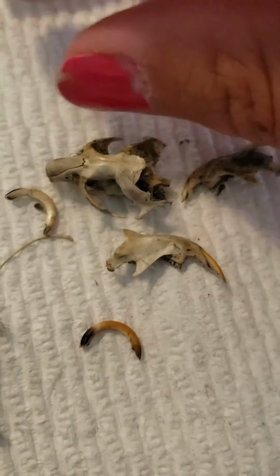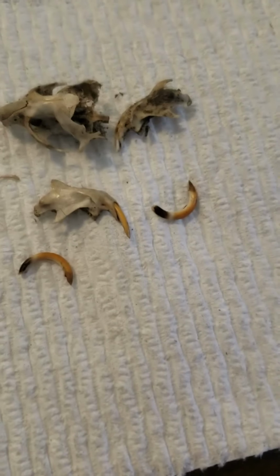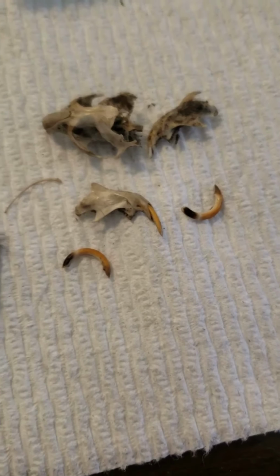And then down here at the bottom, watch out, buddy. Did I break it? No. Down here at the bottom, oh, you did break the little tooth. That's okay. Let me see. I didn't break it. There are teeth right there. So all those yellow things, those are the teeth.